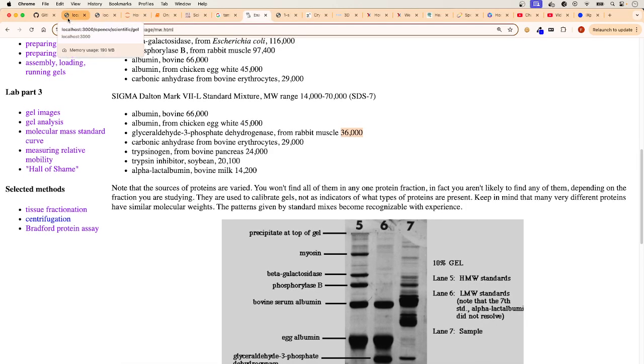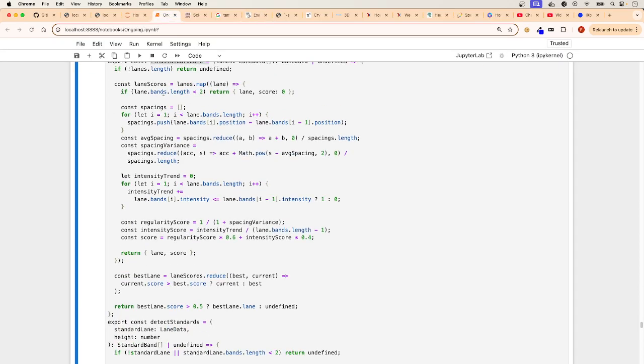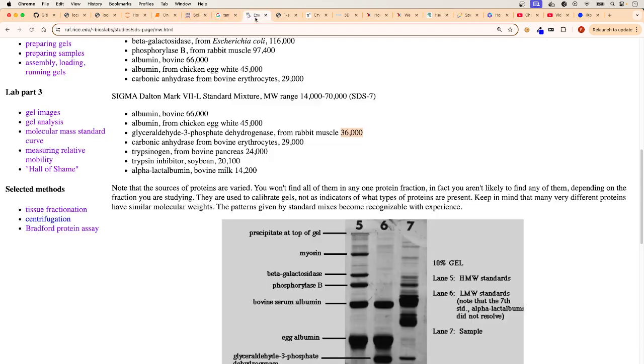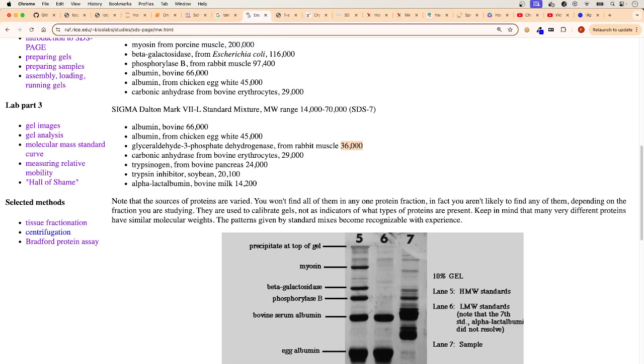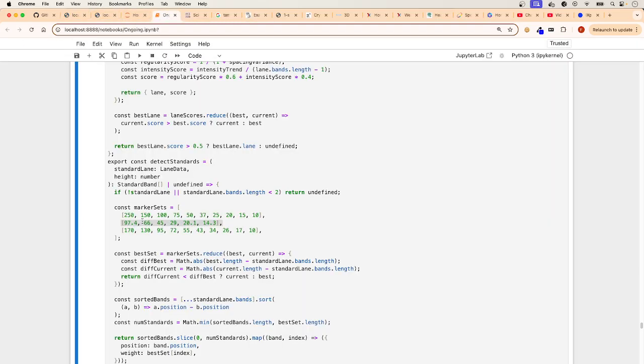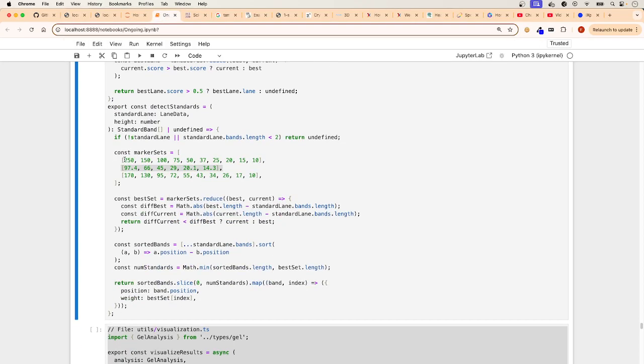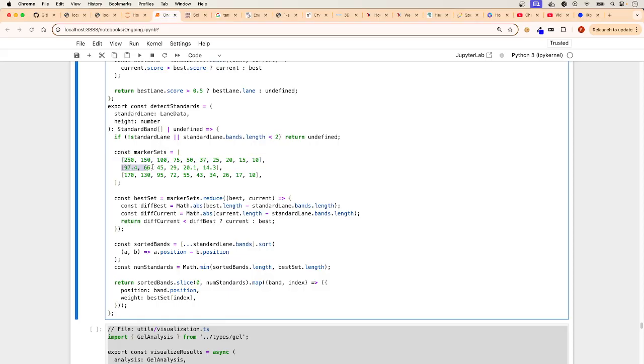So we gotta let the code know what these standards are. And for example, here they are. So that's one set for some gels. These are one for another set of gels. Like the one that he's using here is similar to this one, 66, 45, 36. So this is what you see here. 66, 45, 29, 20, 14, right? So there they are. So that's what's happening. Those numbers, you can change them. You can comment it out. If you're using this particular gel for most of your applications, you just enter your marker setting here. So it's completely optional. You can change them to your heart's content depending on what gel you're using.